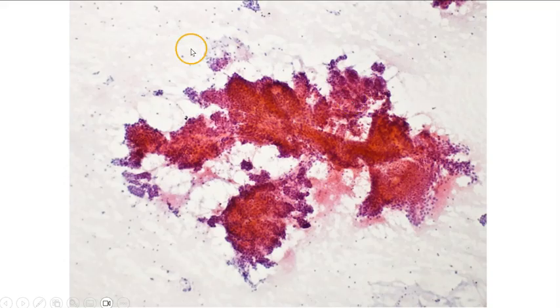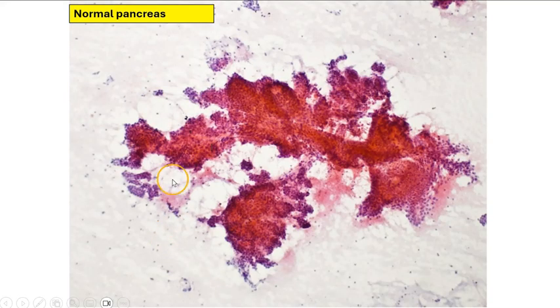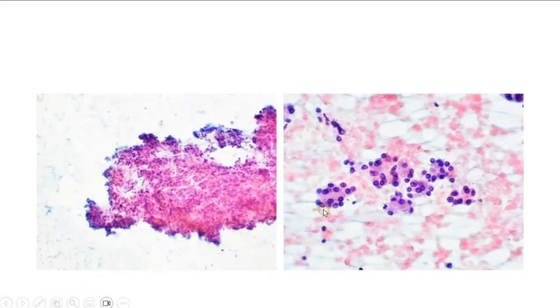And finally, here is an entire lobule of pancreatic parenchyma that has been aspirated. We see here the branching central duct, and these are the grape-like acini that form the exocrine glandular components of the pancreas. So this is normal pancreas. Sometimes the acini are seen embedded within the stroma when the whole fragment is intact. Other times we can see single acini on their own, and this is where we are most likely to mistake them for neuroendocrine tumor because they also look very uniform and can mimic cells of neuroendocrine tumors.